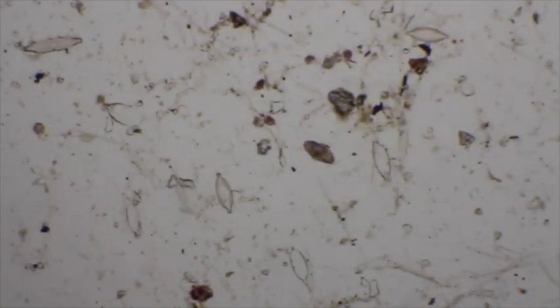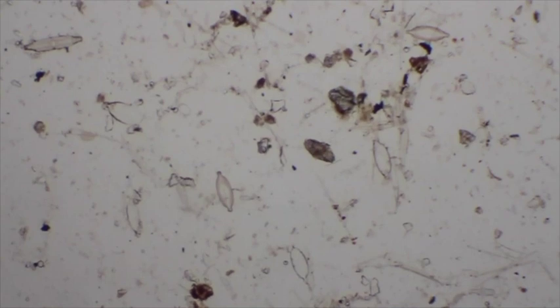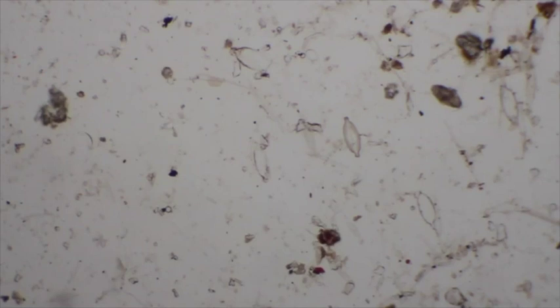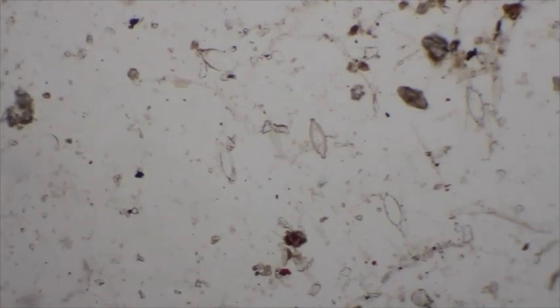So here's a view of the slide under the 4x objective. And I can see a lot of diatoms. So we can see down here most of it is muck, but we can then make out a lot of diatoms. I'm going to increase the magnification to the 10x. I will focus now under the 10x, and your job is to look at these diatoms once we get them in focus and see if any of these match up with the diagrams that we have. So I center that one. Here's a good one. And we'll just focus in.